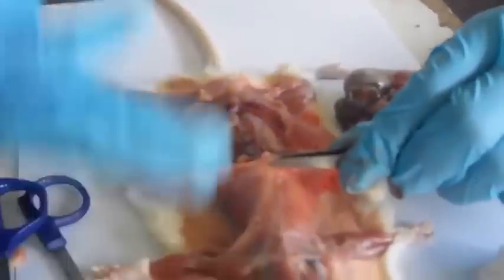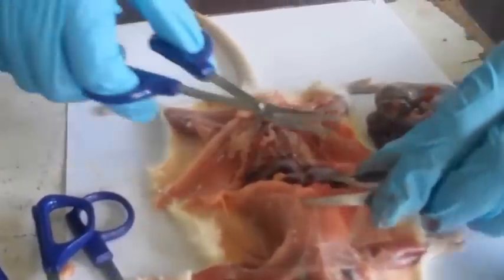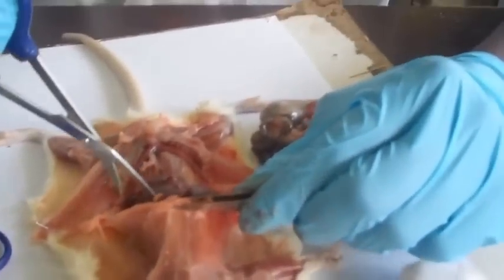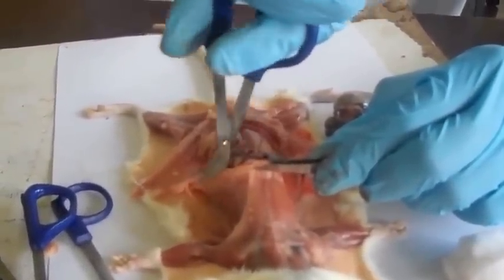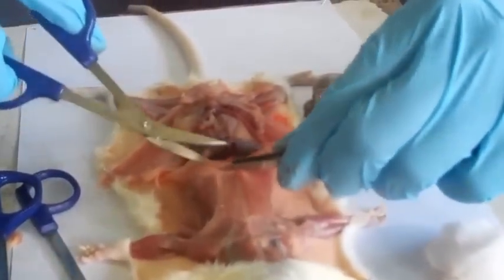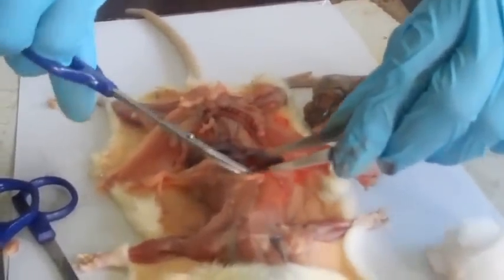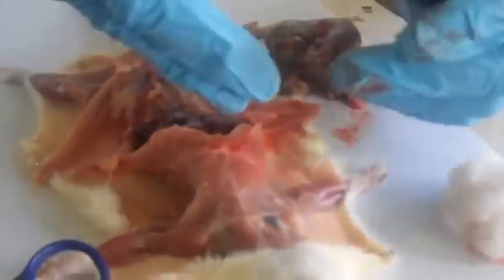So we'll have to first remove this part, and we're going to first cut and leave the diaphragm down. We're going to hold, okay, there's supposed to be a xiphoid cartilage right there, but due to unavoidable circumstances, we've not been able to have it just there. So cut both sides. So we're going to cut along the sides in order to display the heart and all the blood vessels that lie there.